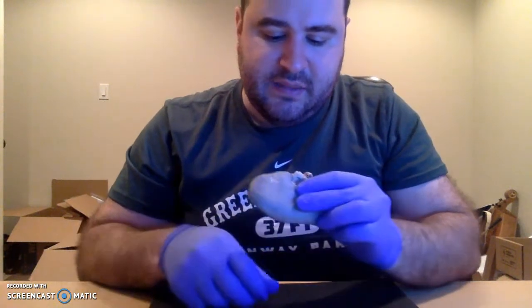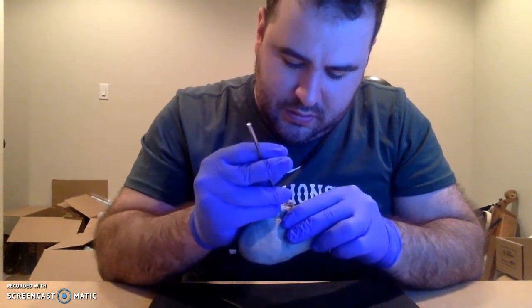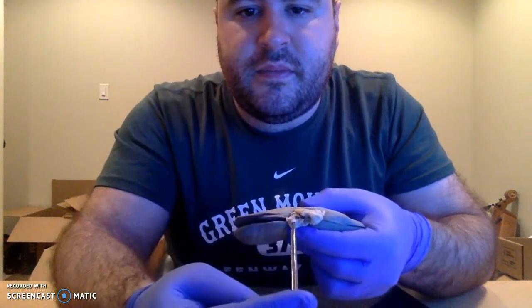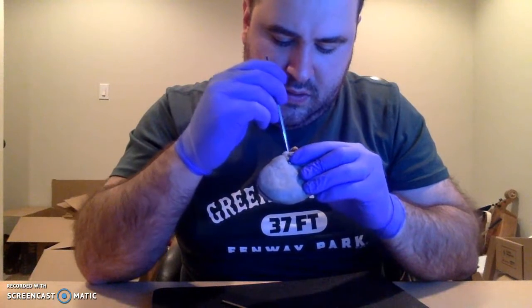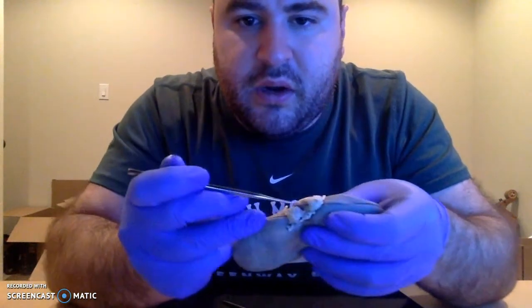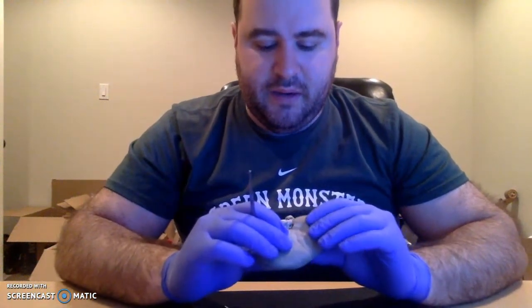And into it pass both, let me get my probe in here. There we go. The renal artery, right? And the renal vein, which runs parallel to it. And we can distinguish between the two because the renal artery has a thicker tunica media. It's an artery, so it's got a much more muscular, thickened appearance.